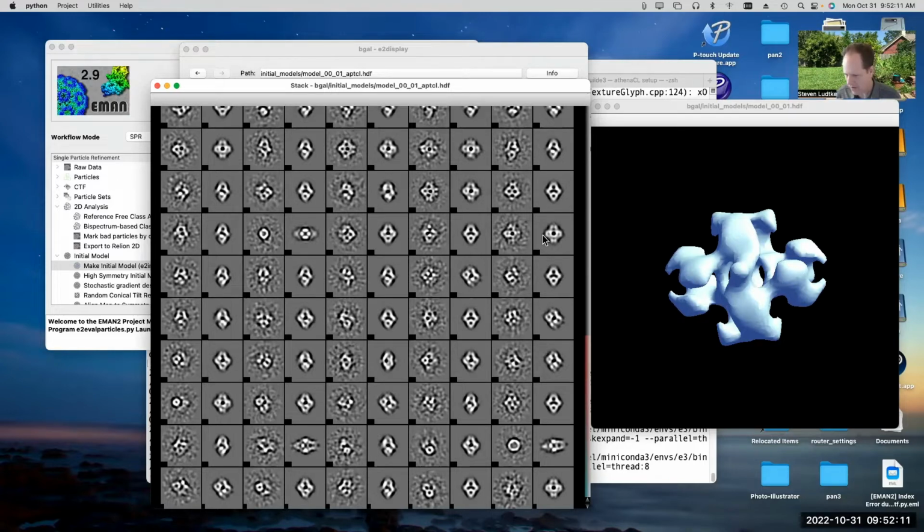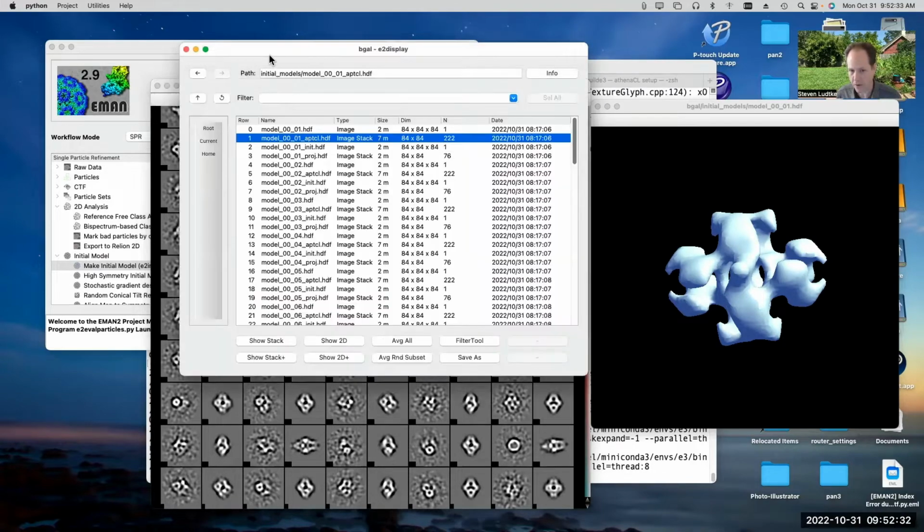So if things went well, you should see this and this agreeing, perfectly to within the limits of noise. You'll see here that some of them agree reasonably well, but others agree really poorly. Like, this sort of end-on view didn't come out with anything. This and this, not really the same, right? I mean, there's some agreement over here, but this is something that I would view as actually a pretty bad result. And this is what came out as our first, what should have been the best result from that trial of running with all of them.